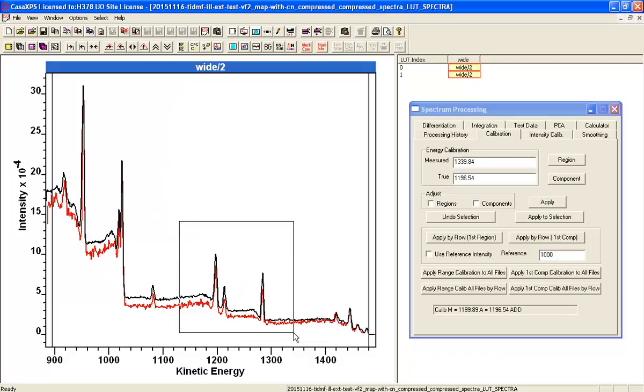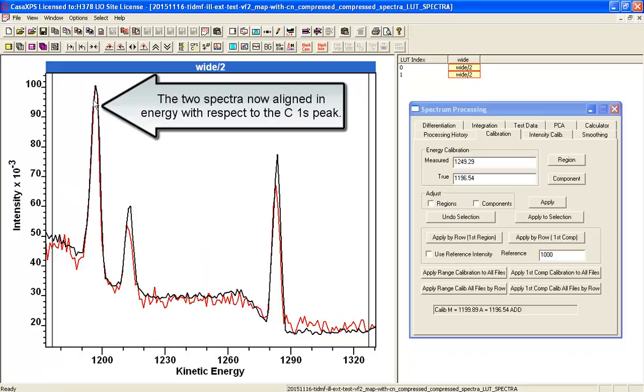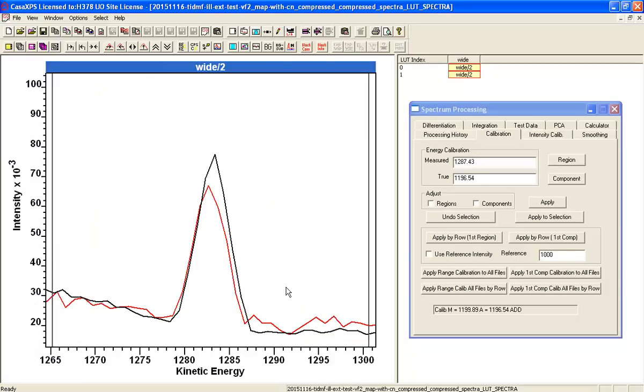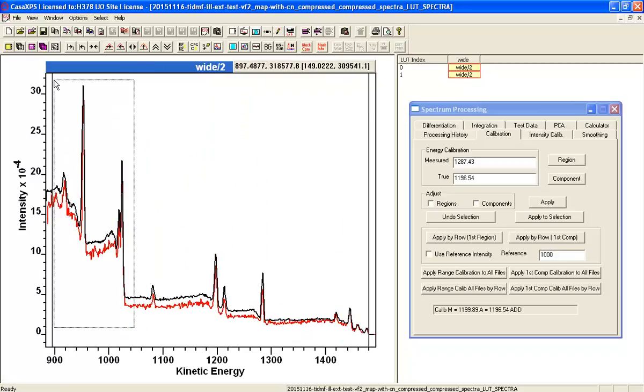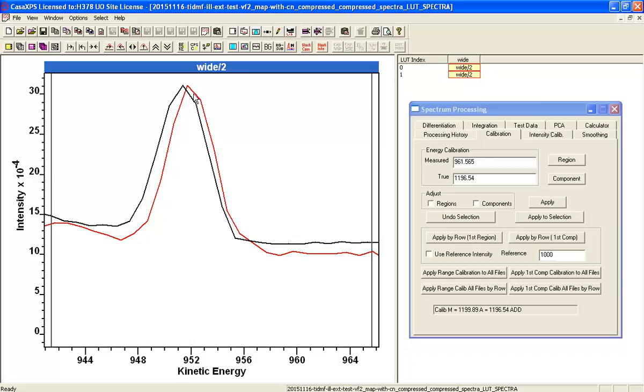So I now have an energy calibration, and I've calibrated on the carbon, so you can see that pretty much there's a reasonably similar energy calibration for that chlorine peak. If I now have a look down here at the lower kinetic energies, we can see that there's a shift. Even though I've got a calibration based on the carbon, I've got a shift in the oxygen peak.